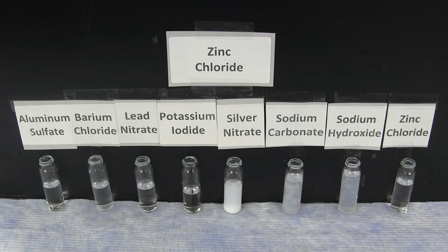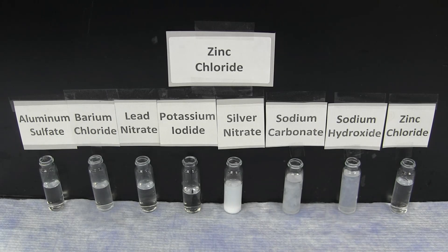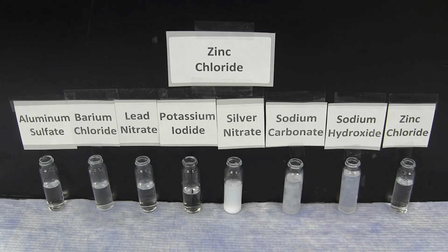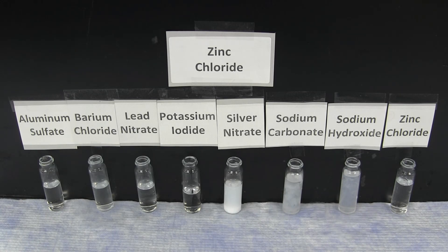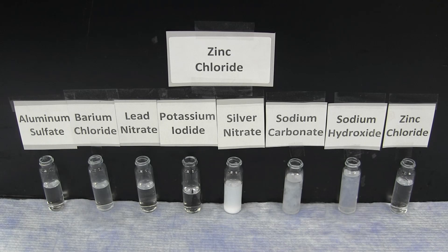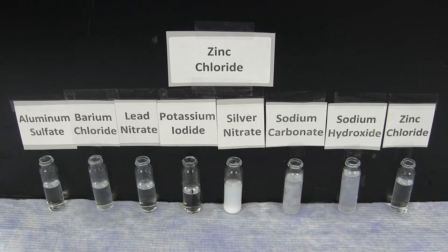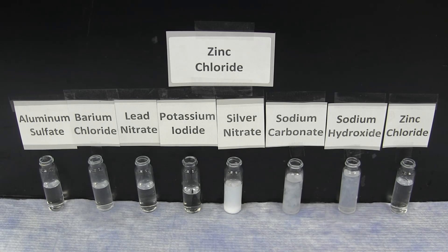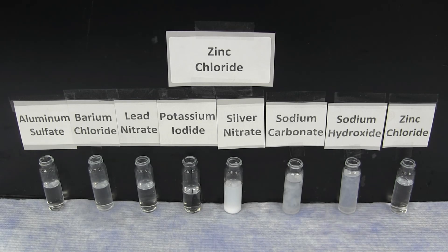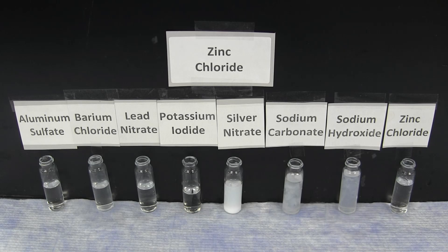With all of the reaction patterns observed, you can now use these observations to determine the identity of your eight unknown solutions. The eight unknown solutions are all reacted with each other, and you can use these observations of known reactions to conclude what the identity is. You can use obvious reactions, such as those with lead nitrate and silver nitrate, to identify specific reaction combinations quickly. And then, from there, think of it like a puzzle — you're going through and trying to figure out what the different patterns are and what the different compounds are in the overall reactions. Thank you.